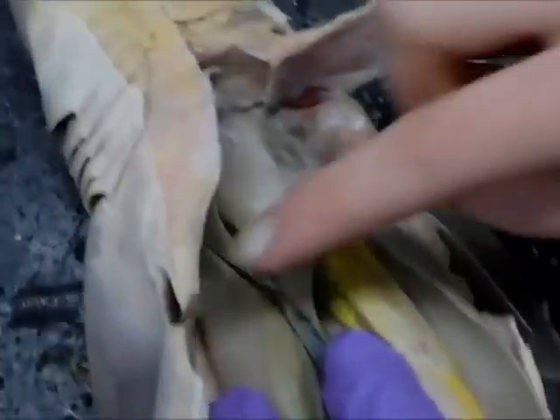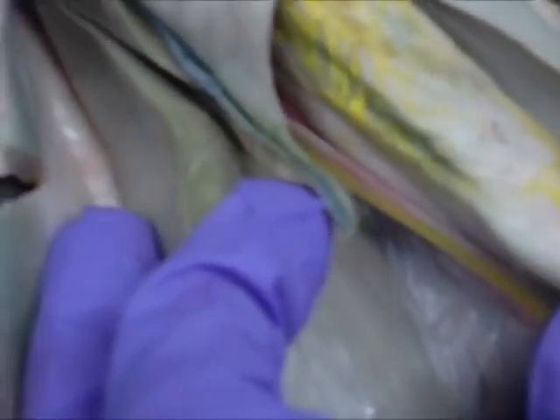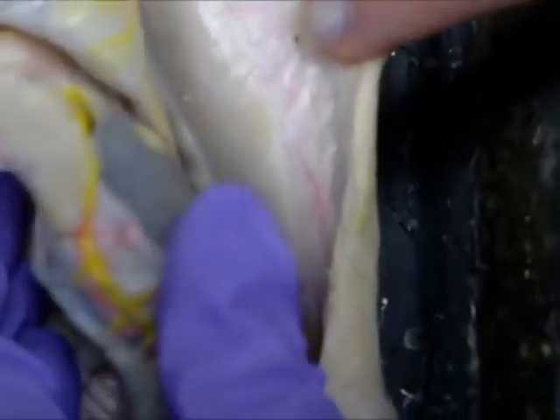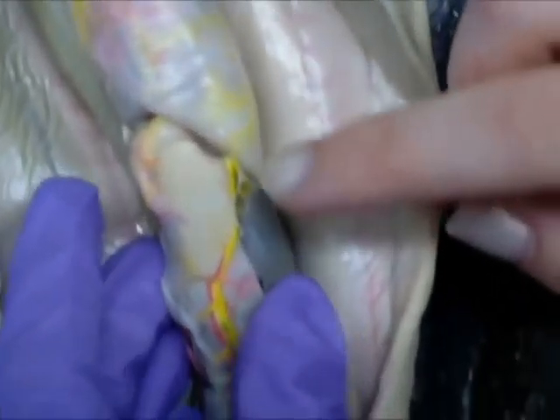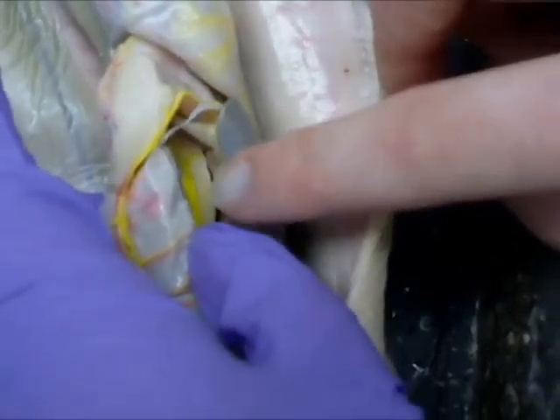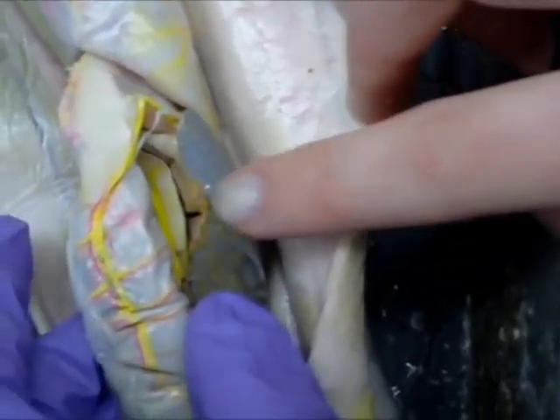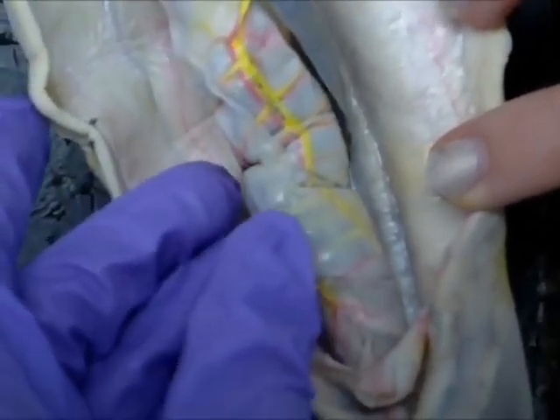I believe this is the gallbladder here — the only blue in the shark. From the stomach, we go down to the spleen right here. And then the pylorus, which leads to the pancreas, which is probably this. After the pancreas, we have the valvular intestine, which is awesome.